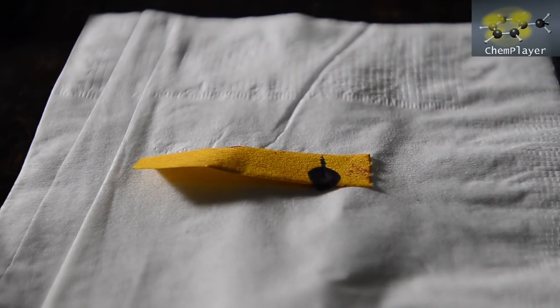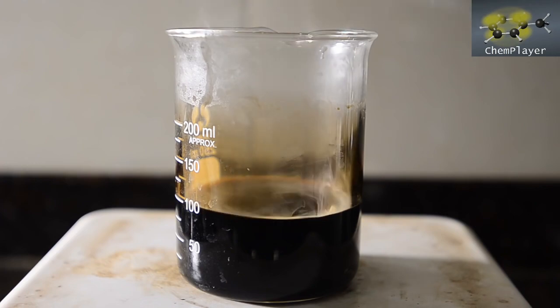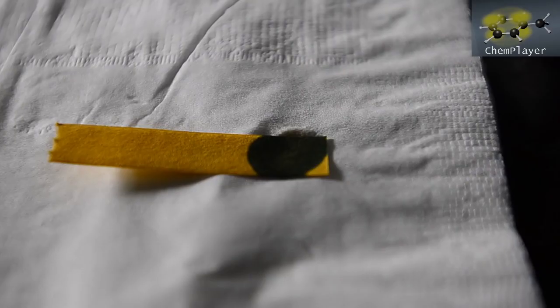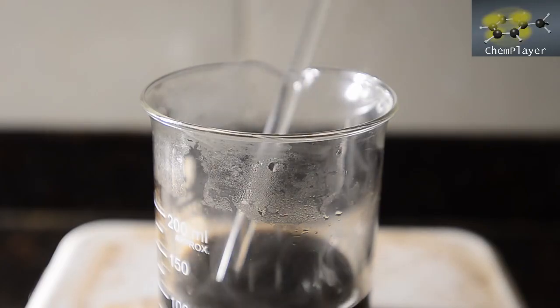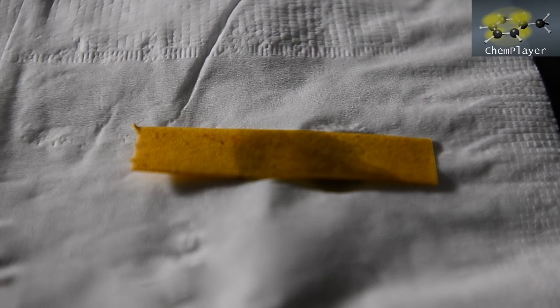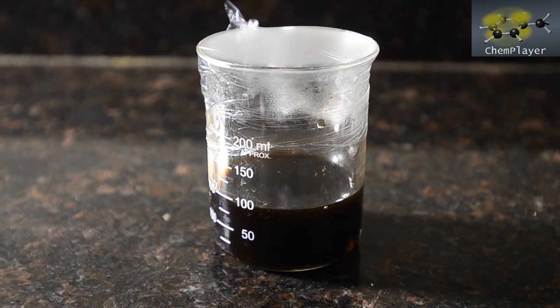pH is still strongly alkaline, so we've got a way to go. The mixture warms slightly and neutralization takes place. Slightly less alkaline now. Towards the end we add the acid drop-wise carefully. Definitely at between pH 6 and 8 now, although the color of the liquid makes it hard to tell. So we covered up the mixture and now we're going to chill it down for a few hours in order to see if we can get any product coming out.